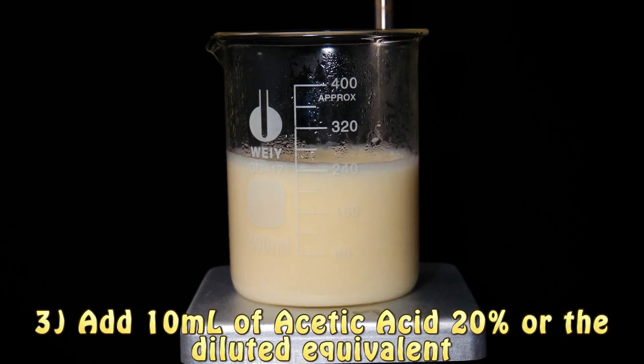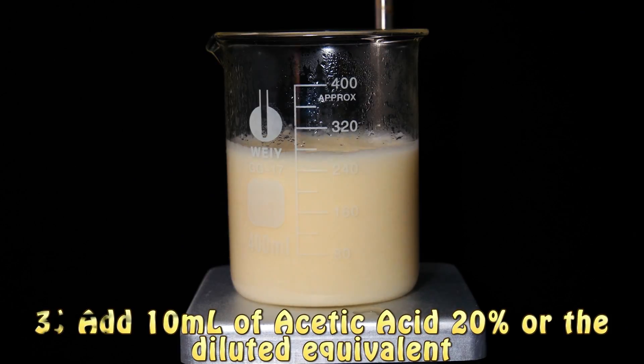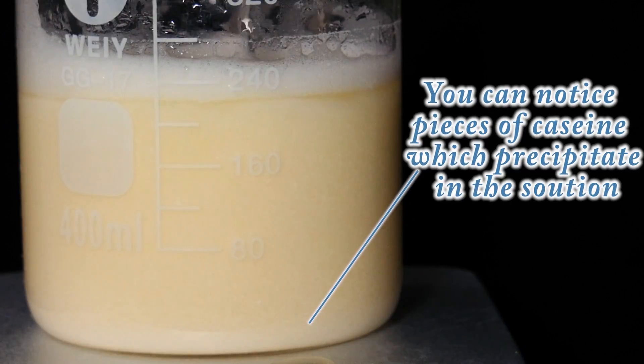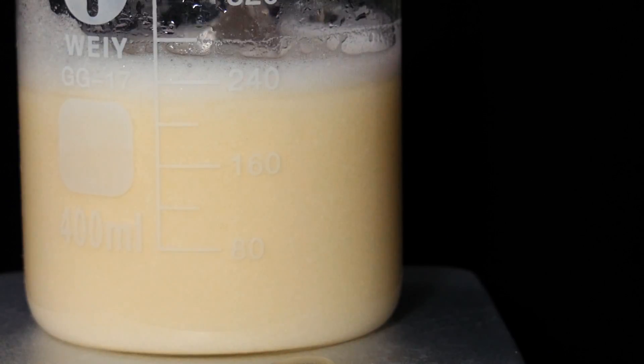The next step is to take 10 milliliters of acetic acid, concentrated at 20%, or the equivalent diluted. We mix this solution into our milk and then we see a precipitate forming. We filter it out and gather it on our filter paper, then continue to experiment with the remaining solution. We wash the precipitate with hot water in order to remove everything from it.